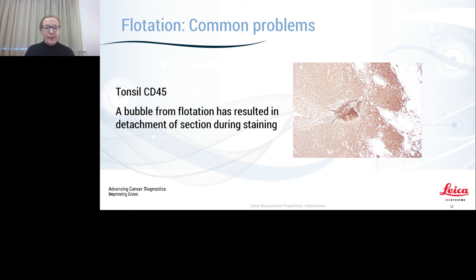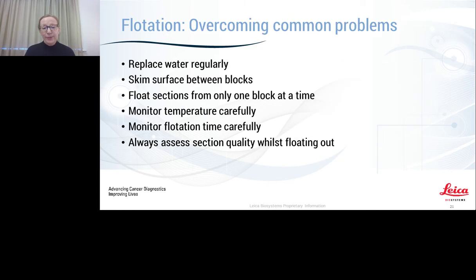So you can see some of the issues that can happen. A bubble from flotation has resulted in the detachment of the section during staining. Where the tissue wasn't obvious when you cut the section or dried the section, there is still a bubble that will cause problems, and it could be a critical part of that particular tissue that you were looking at in downstream staining processes. So just some things to think about.